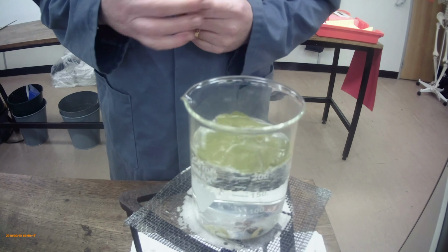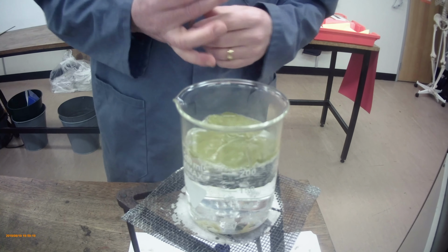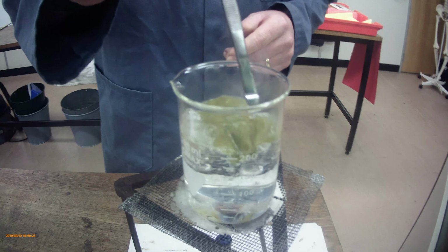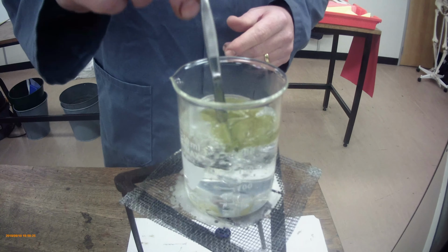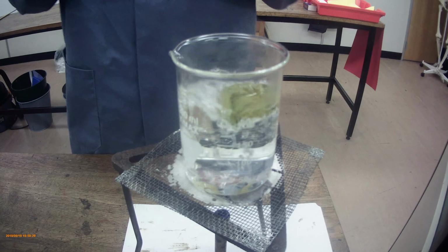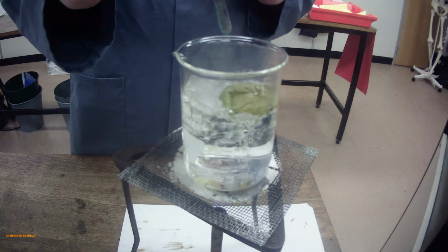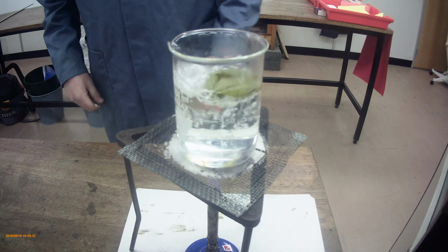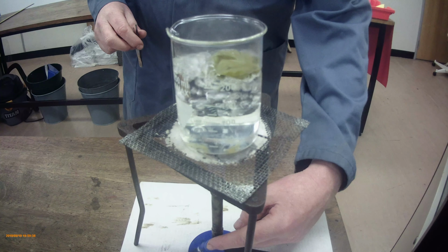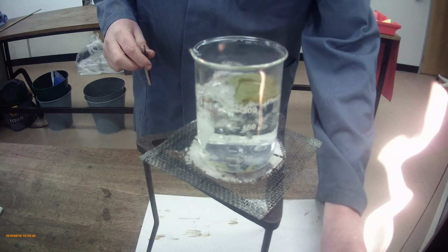Right, as you can see now, we've got our leaf, a big change in colour from the sort of bright green we had, and the leaf is now boiling. If I was going to eat this, it would probably be nicely cooked by now. The wax layer is coming off quite nicely, and the cell wall is softening down as it's in the boiling water. What we're going to do at that point is just take the Bunsen back to safety, and take it out of the way.